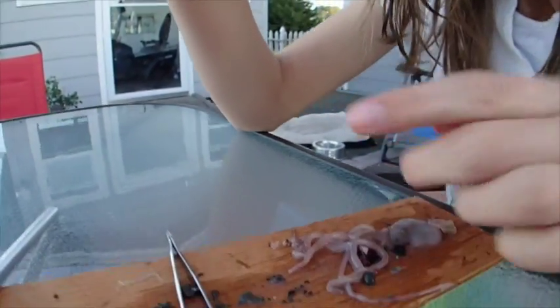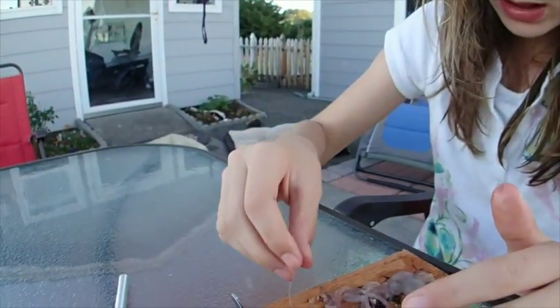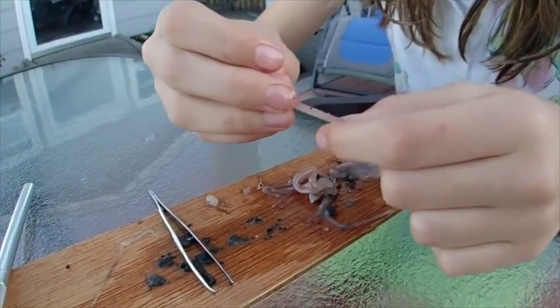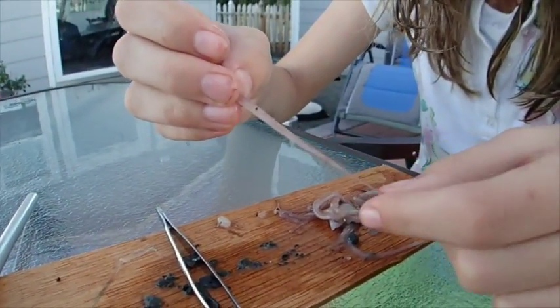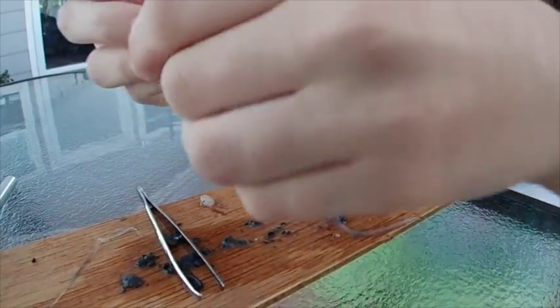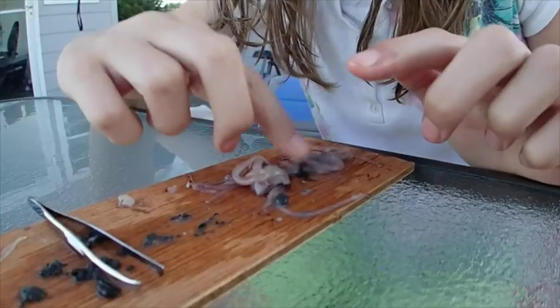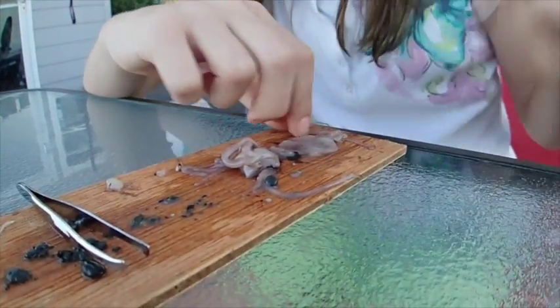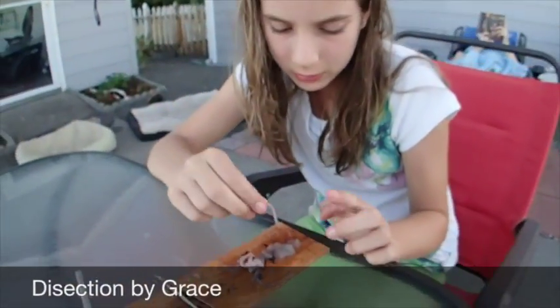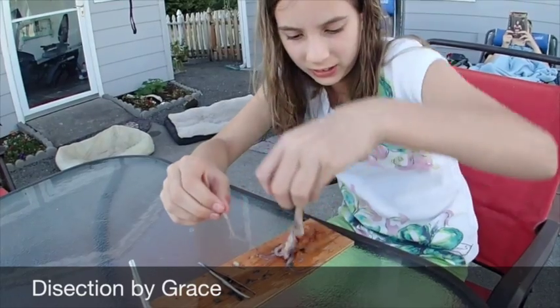That's its stringy, gooey brain — just a couple of neurons there. Squids are not very smart. Does it have suction cups on it? Not really — it has little tiny ones. I think this one was a girl because I don't feel the weird little things — like little white banana-shaped things. Squidward.